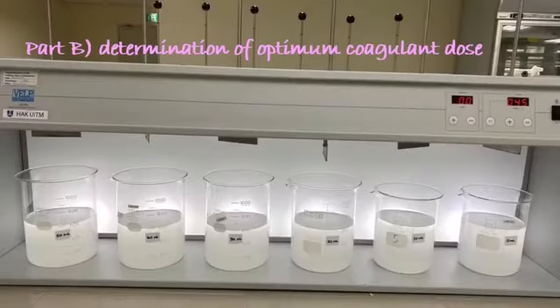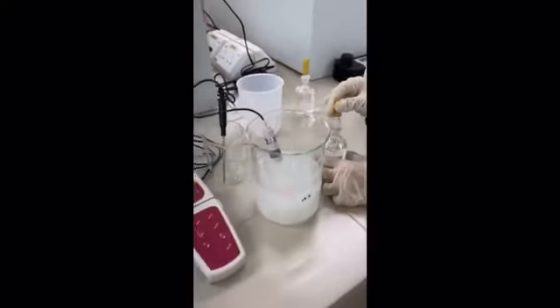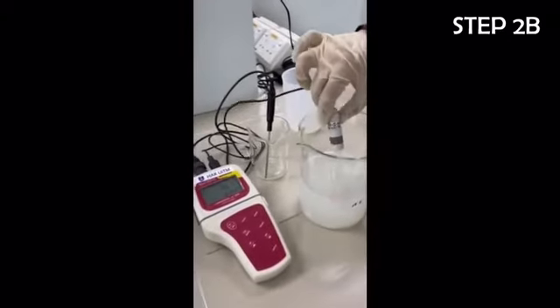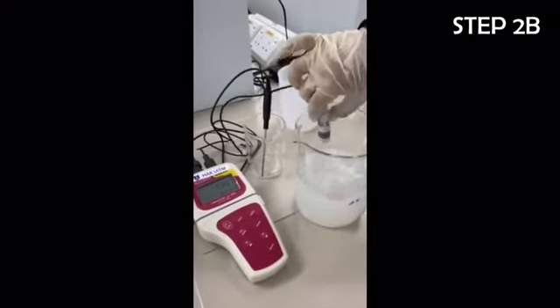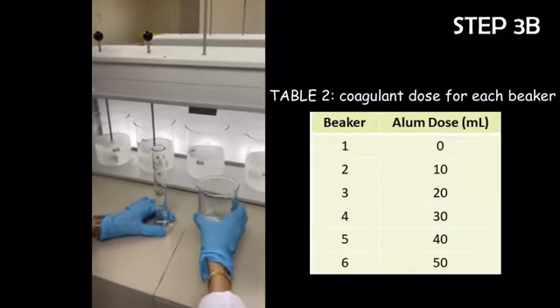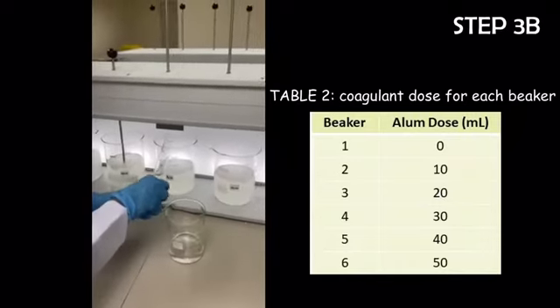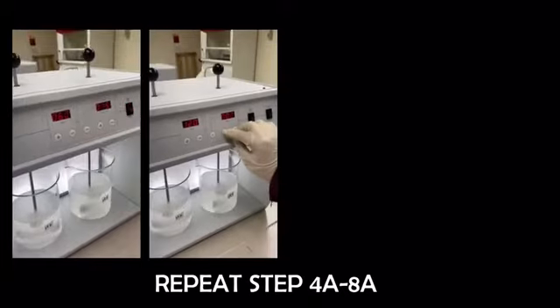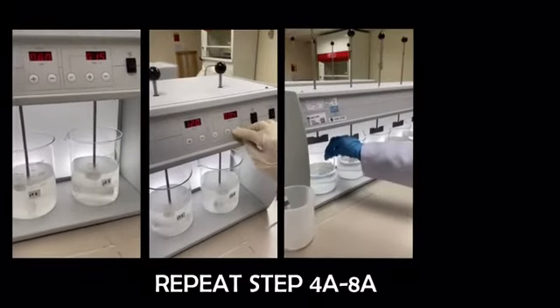Next, the determination of optimum coagulant dose for turbidity removal was carried out by repeating step 1A. Based on the result of the previous experiment on determination of optimum pH, each beaker was adjusted to pH 7, using 1% sulfuric acid or 1% sodium hydroxide. Then, the coagulant dose was added to each beaker, according to Table 2. After dosing each beaker, steps 4A until 8A were repeated, accordingly.